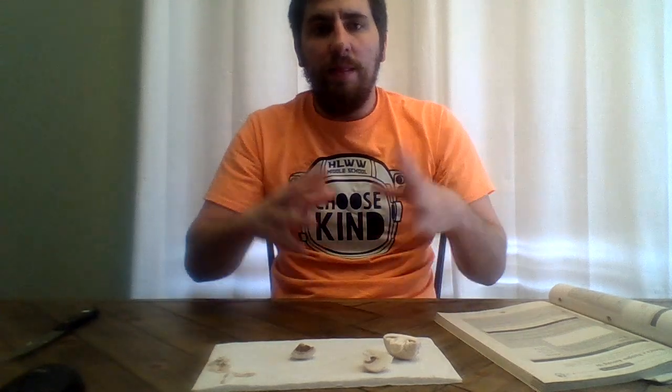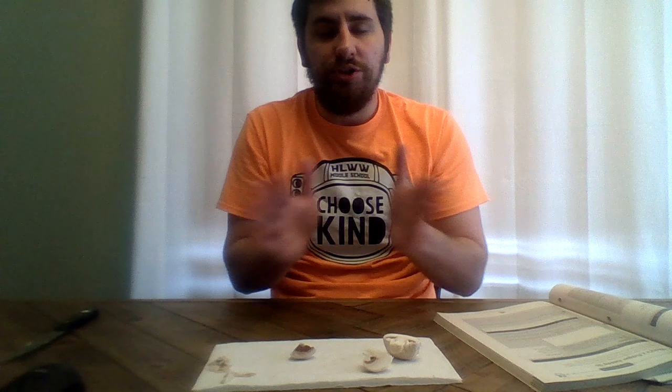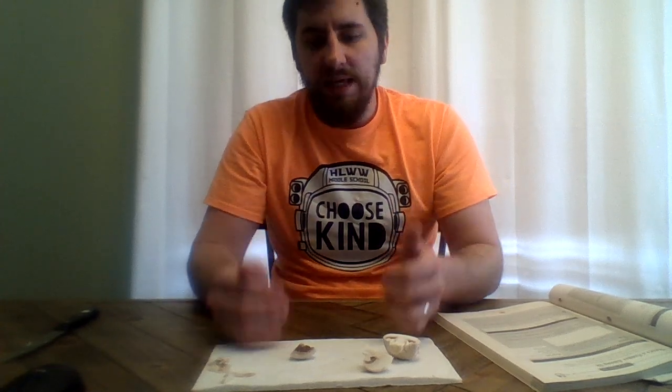So, what are the gills for? The gills are where the spores are created, and then where they're released when the mushroom has decided it wants to release the spores. And those can be either through asexual or sexual reproduction, but the spores are what's going to be the main reproduction method of a mushroom, which is very unique.